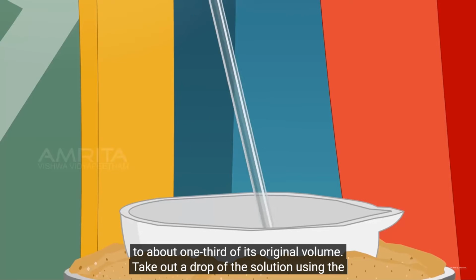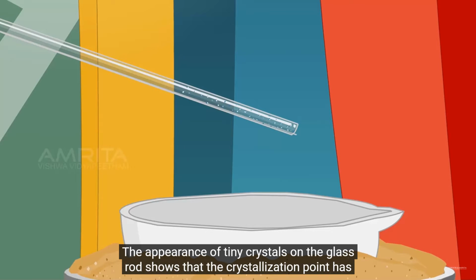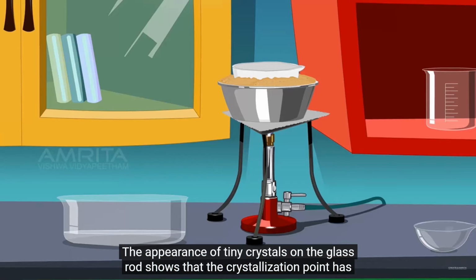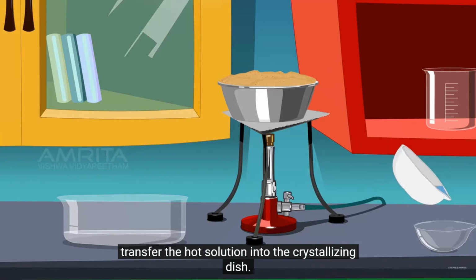Take a drop of the solution using the glass rod and cool it by gently blowing on it. The appearance of tiny crystals on the glass rod shows the crystallization point has now been reached, and now turn off the burner and stop heating.